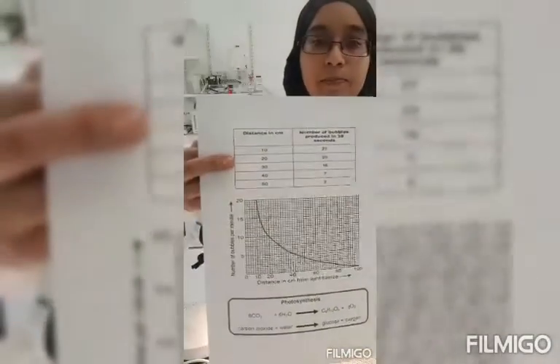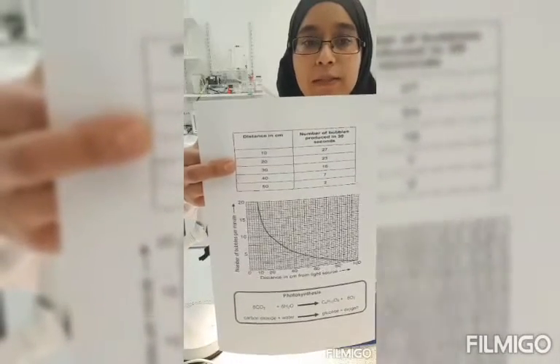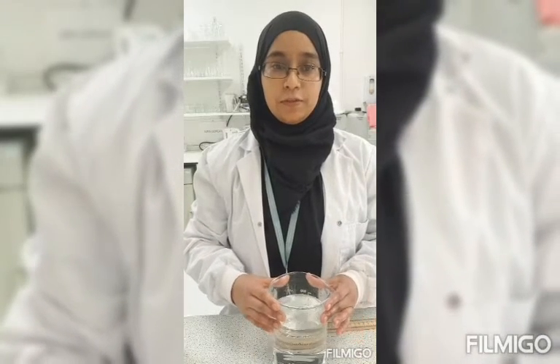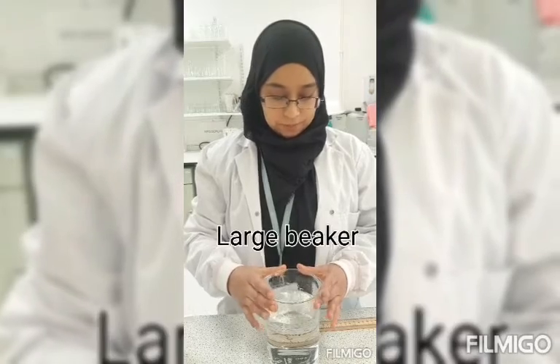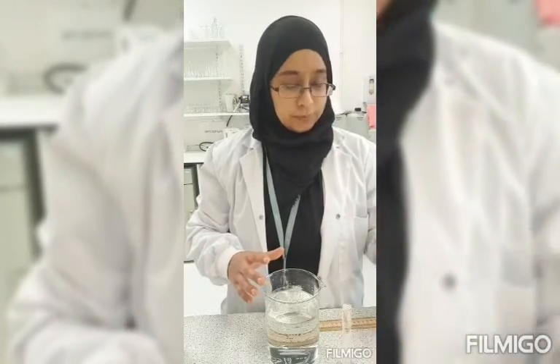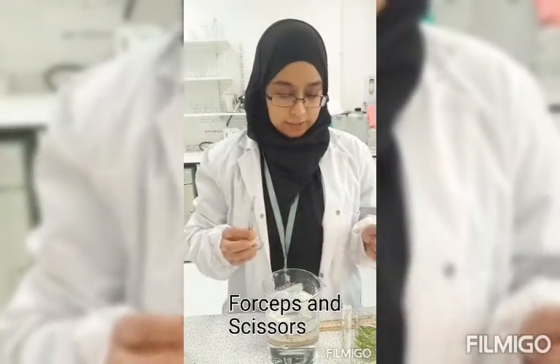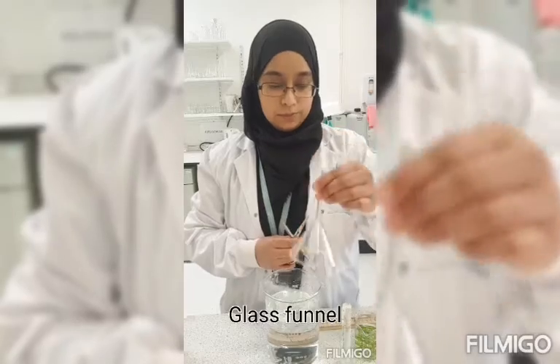The formula for photosynthesis is carbon dioxide plus water gives you glucose and oxygen. To measure the amount of oxygen being produced in photosynthesis, you can use a different method. So you will need a large beaker full of water, a small measuring cylinder full of water, your pondweed, again forceps and scissors, and you will need a glass funnel.